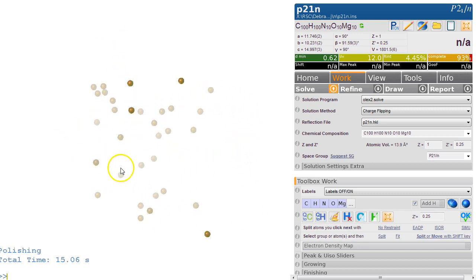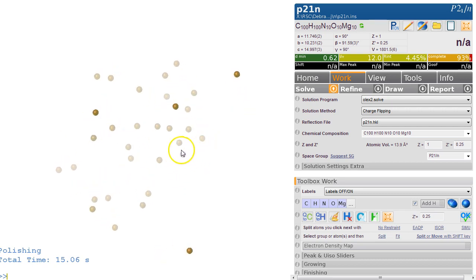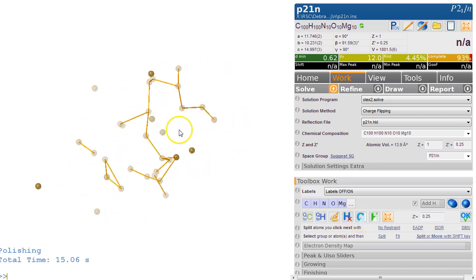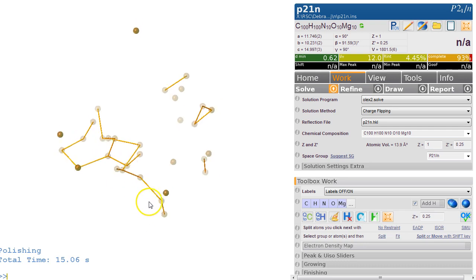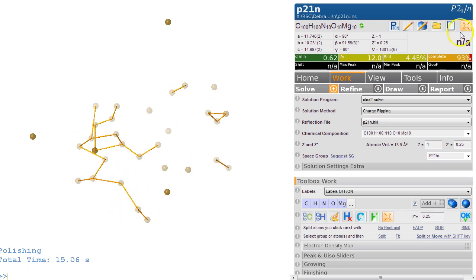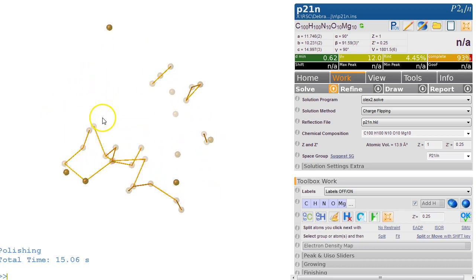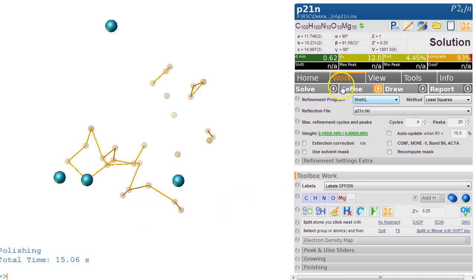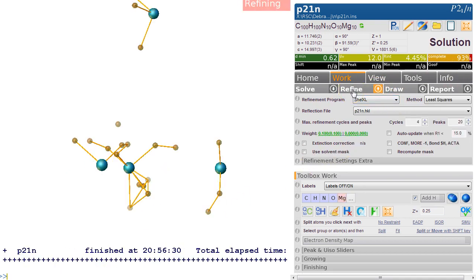So there we go. We see the Q peaks. So these are the electron density maxima we've got in our structure. If I click on this Q again, I can see some bonds. Now that doesn't look like a very promising solution. And we know there's possibly magnesium in there. So what we'll try to do is just to select these heavier things as magnesium, and we go name MG. And just refine it and see what we get.